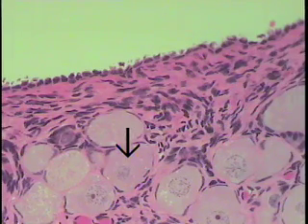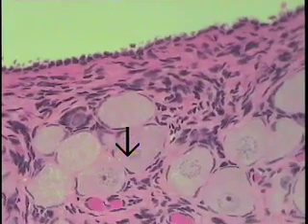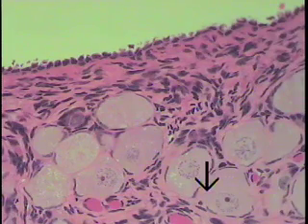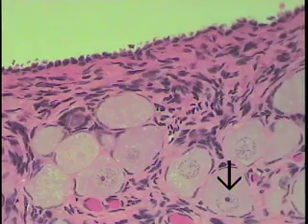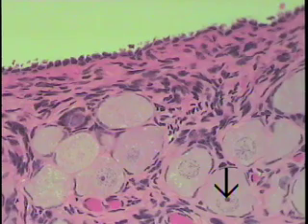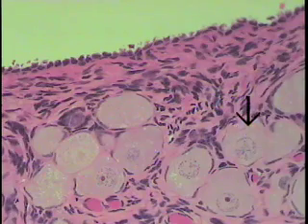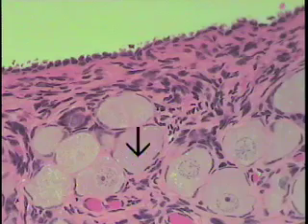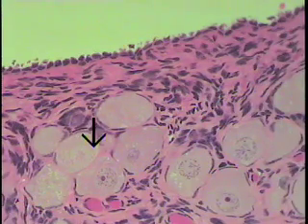All of these large structures here are known as primordial follicles. This would be the oocyte contained within the primordial follicle — its cytoplasm indicated by the arrow. This is the edge of the nucleus, and one can see here a very distinct nucleolus within the nucleus as well. So all of these large light-staining structures are the ova, or the oocytes, within the cortex of the ovary.